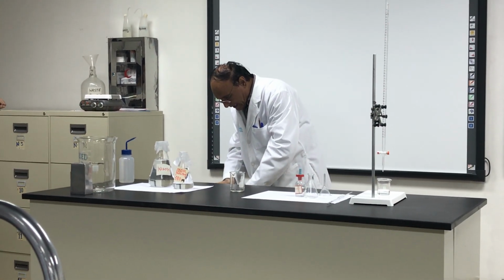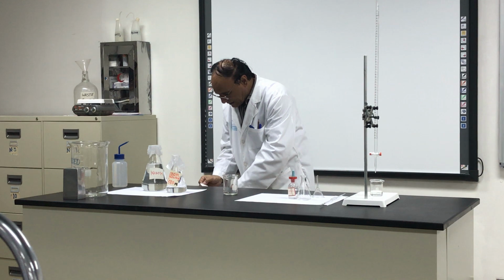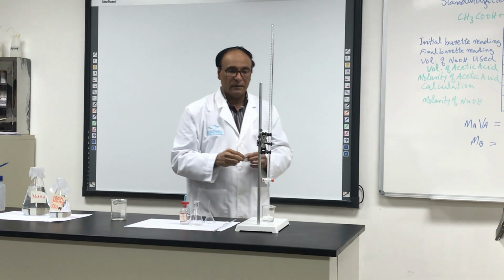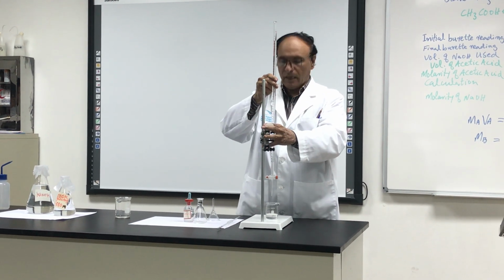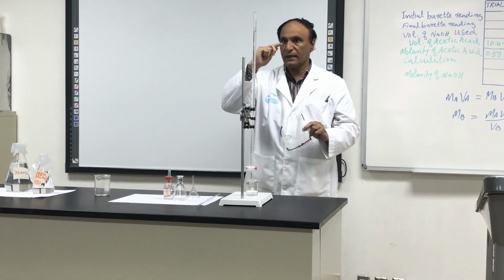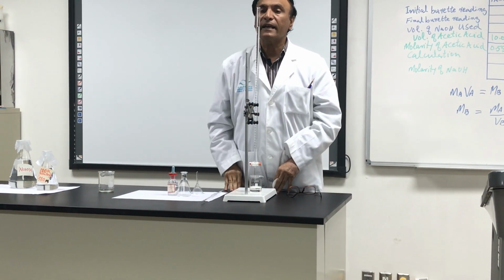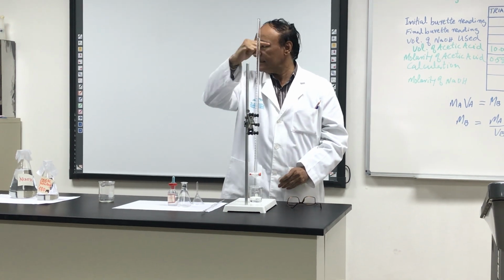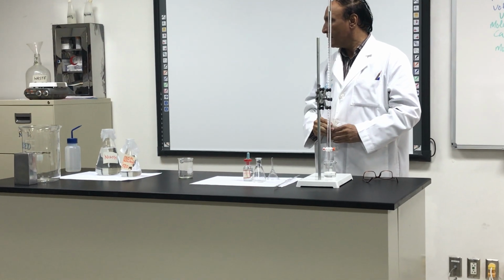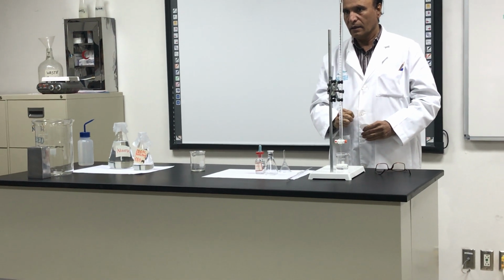When I take the reading, I put some white paper behind it, any small piece of paper from your notebook. Take it and move it down, straight in line with your eyes. Don't read it like that, and don't read it like this. Your eye and this level. If you're short, move it down. Move it down.